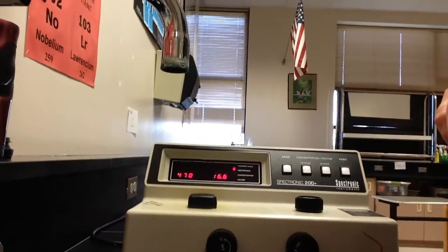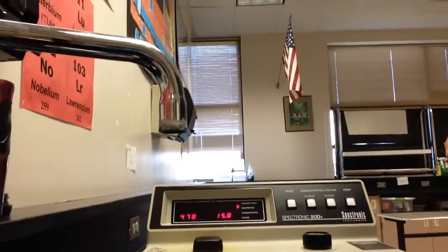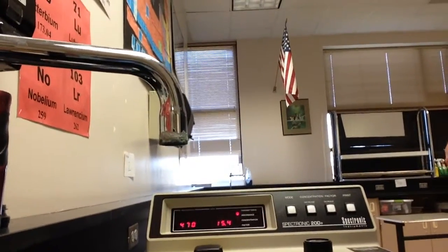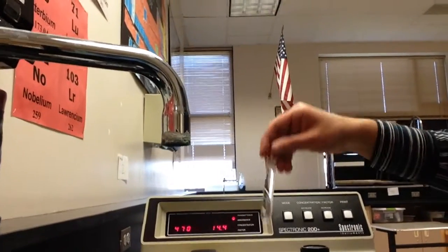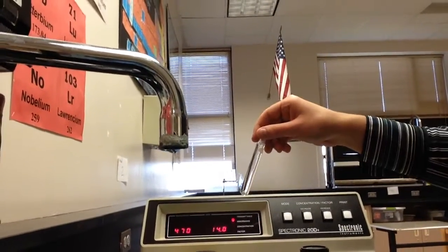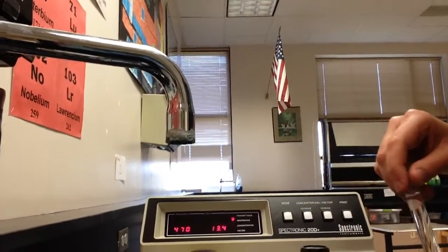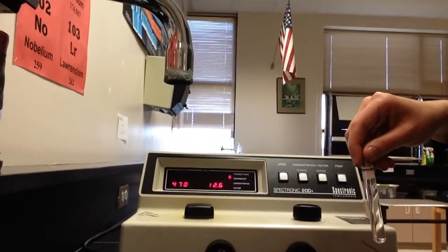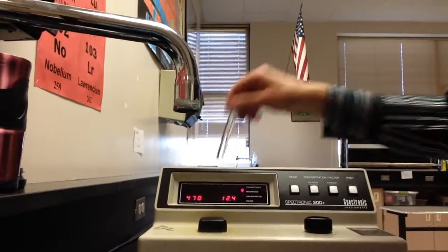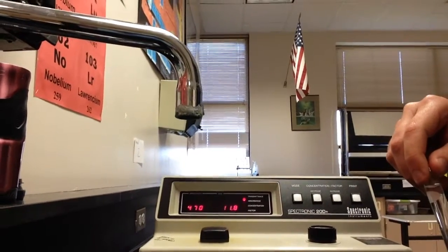The reason it doesn't really matter that we only have 5 spectrophotometers is because you only need the spectrophotometer for 5 full minutes. Once you're done, you take that cuvette out and put the blank back in so that the next group can blank theirs, making sure that you have 100% transmittance and 0% absorbance. So you take that cuvette back out, you put the blank back in, and then you're done. You're ready to graph your data.